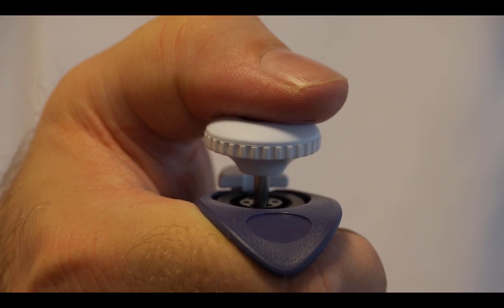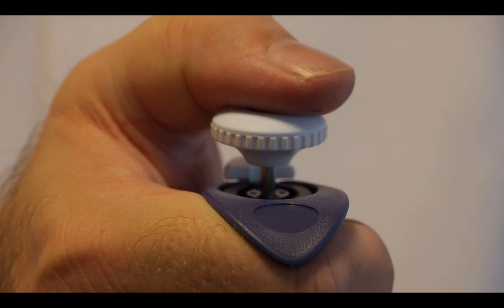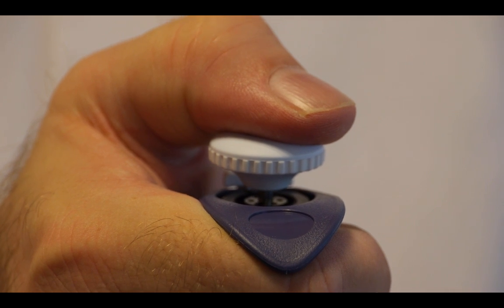The plunger you push down to the first stop, tip into the liquid, bring up slowly, push down again to expel the liquid and then push through to expel excess.